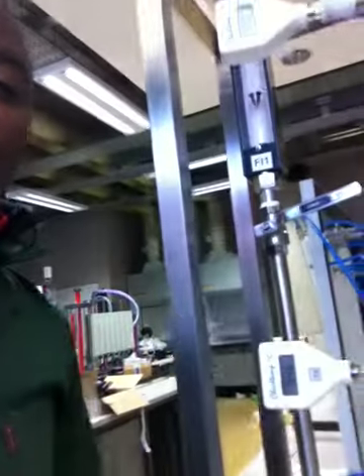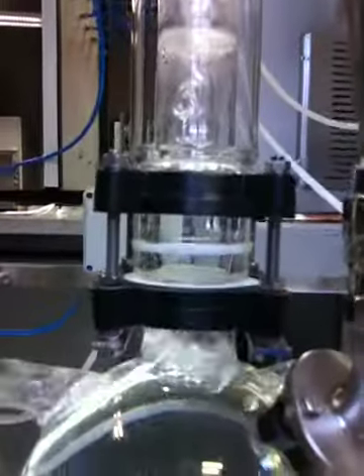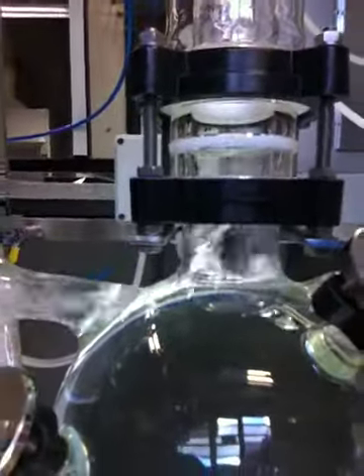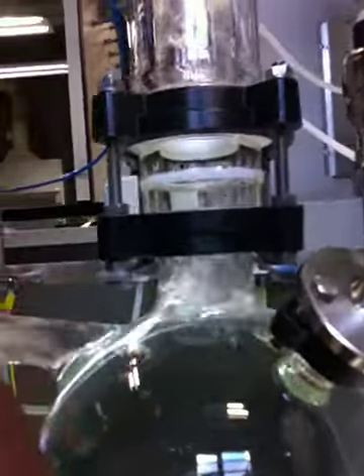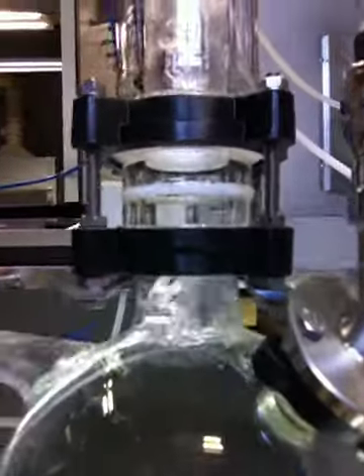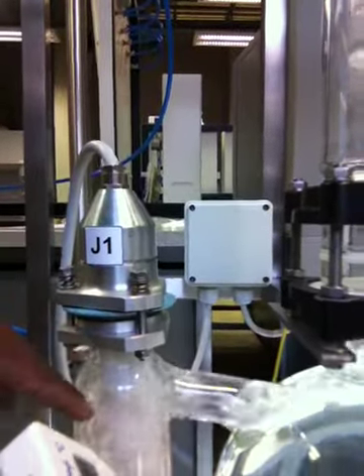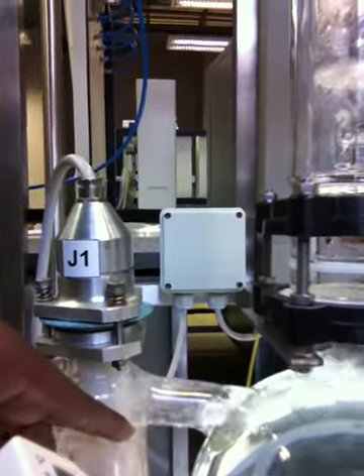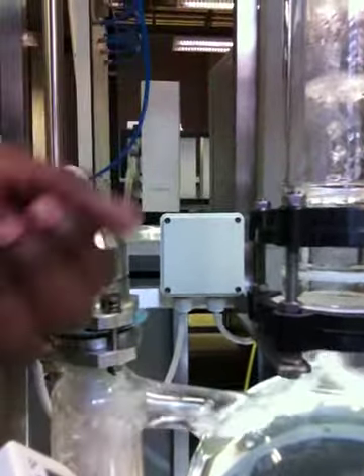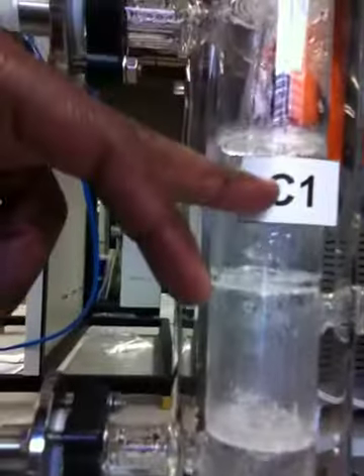So as you can see from the process itself, we are actually in front of the equipment, as I'm gonna give you a view a little bit. It's very interesting to know what is going on in there. As you can see, we have what you call the reboiler, which is represented by E1, as well as what we call the heater. It's the one that is boiling the process so that the vapor can proceed into what we call the column. This is the column.